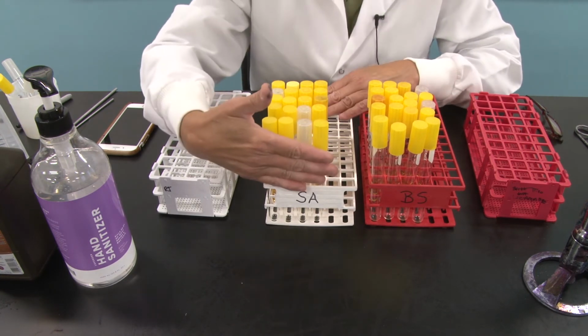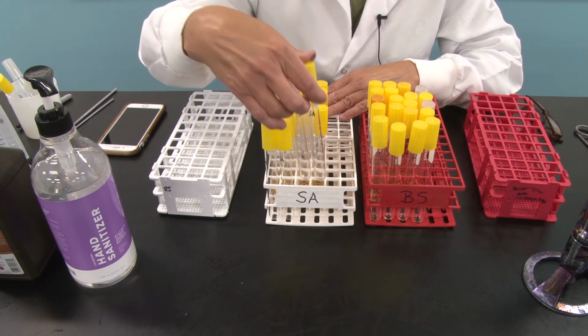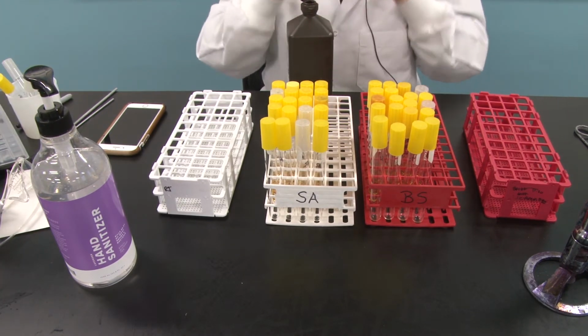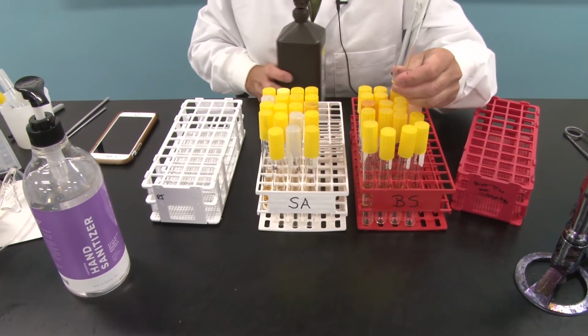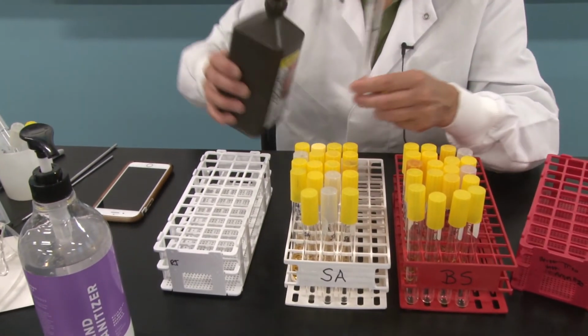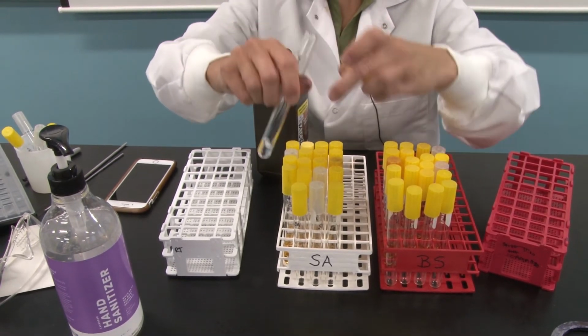And I have in front 4 empty sterile test tubes. They've been autoclaved and they're sterile. So I am going to take in each rack here some hydrogen peroxide, and this is not particularly controlled, but I am going to pour into this tube about a thumb's width worth of hydrogen peroxide.